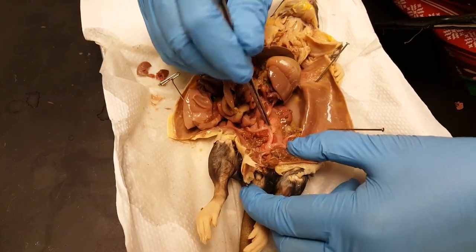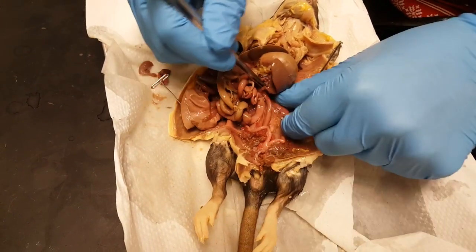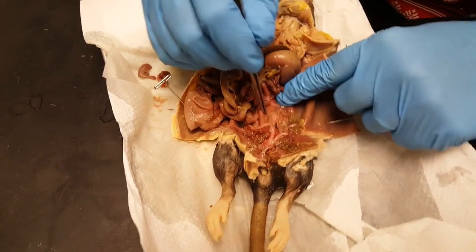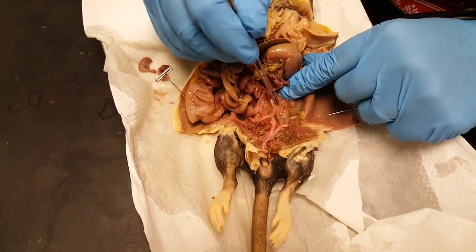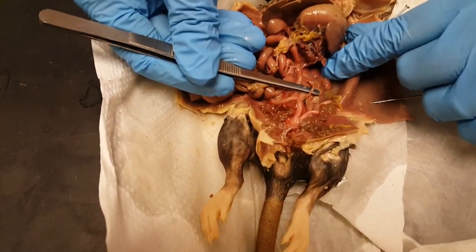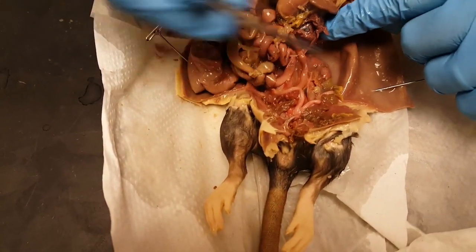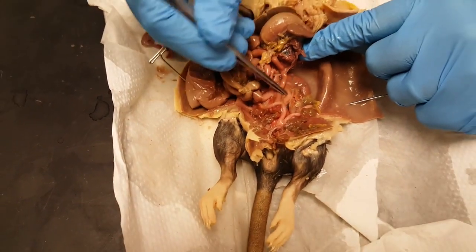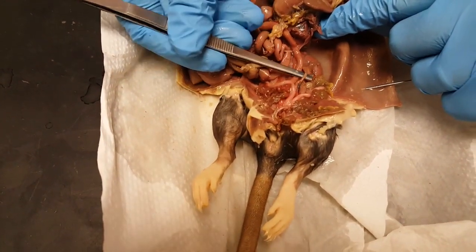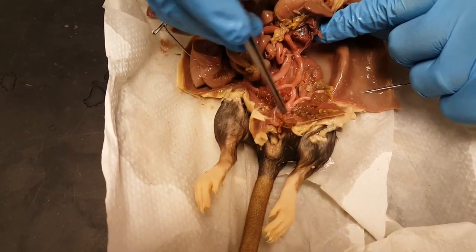It'd be kind of hard to find on some of these. Sometimes I can wiggle it and get it to — oh, there it is, right there. It's very tiny. So: kidney, ureter, bladder.